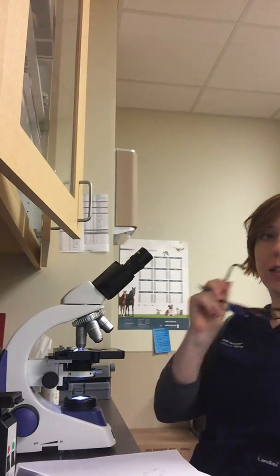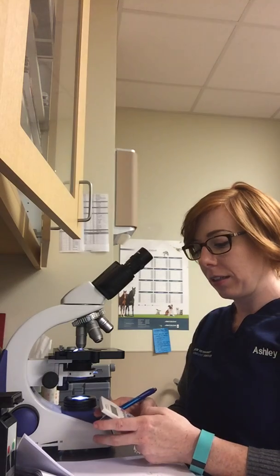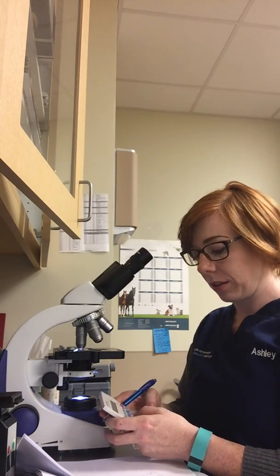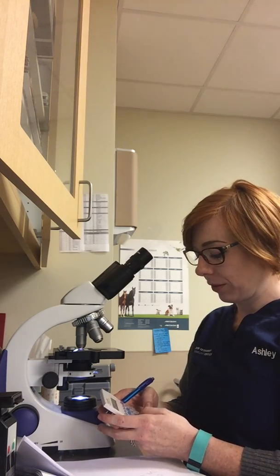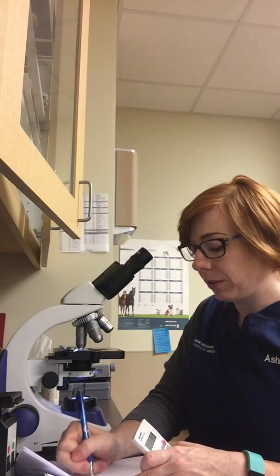So now I have the 10 fields. I'm going to take the average. You can pass me that calculator. Yeah. So 10 plus 8 plus 7 plus 6 plus 7 plus 7 plus 6 plus 8 plus 7 plus 5, divided by 10. So my average is 7.1 in each field.